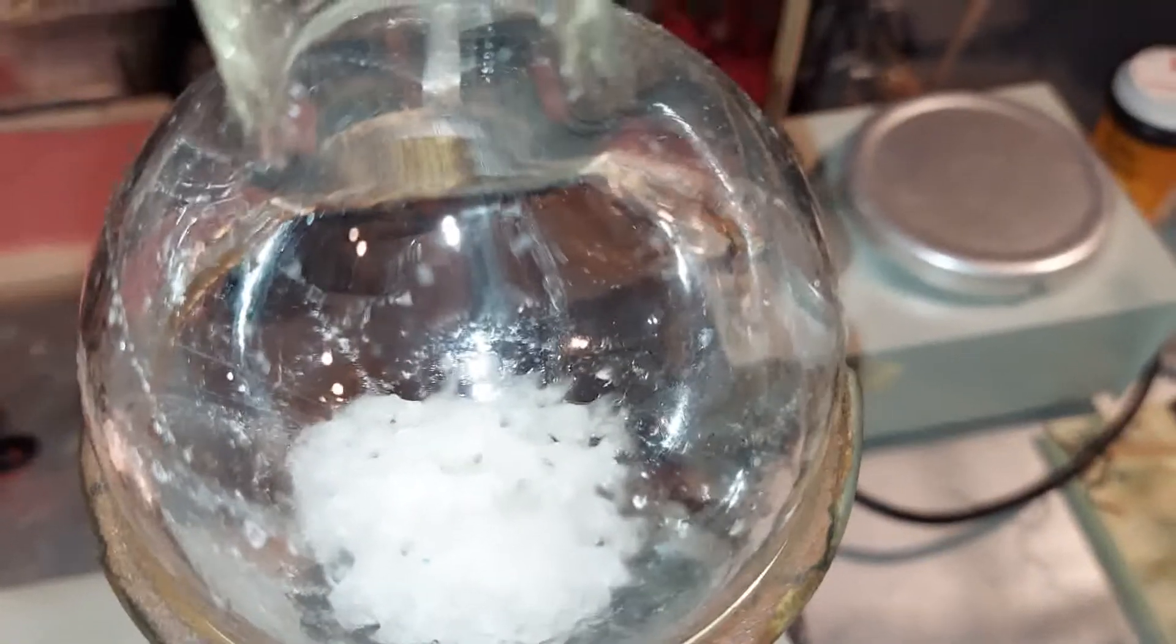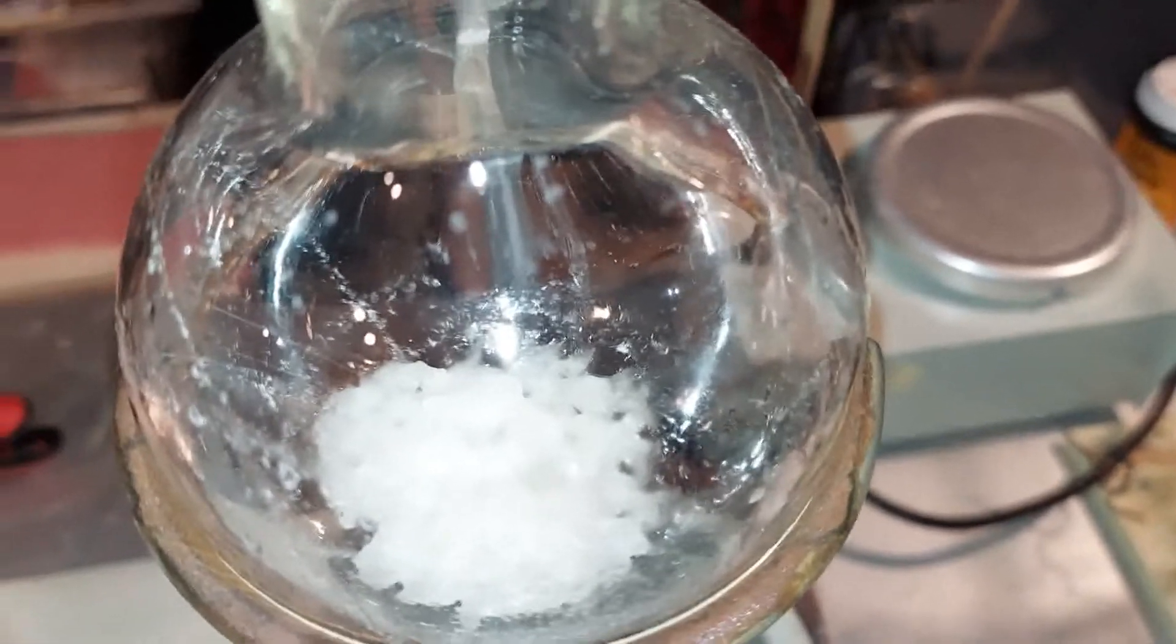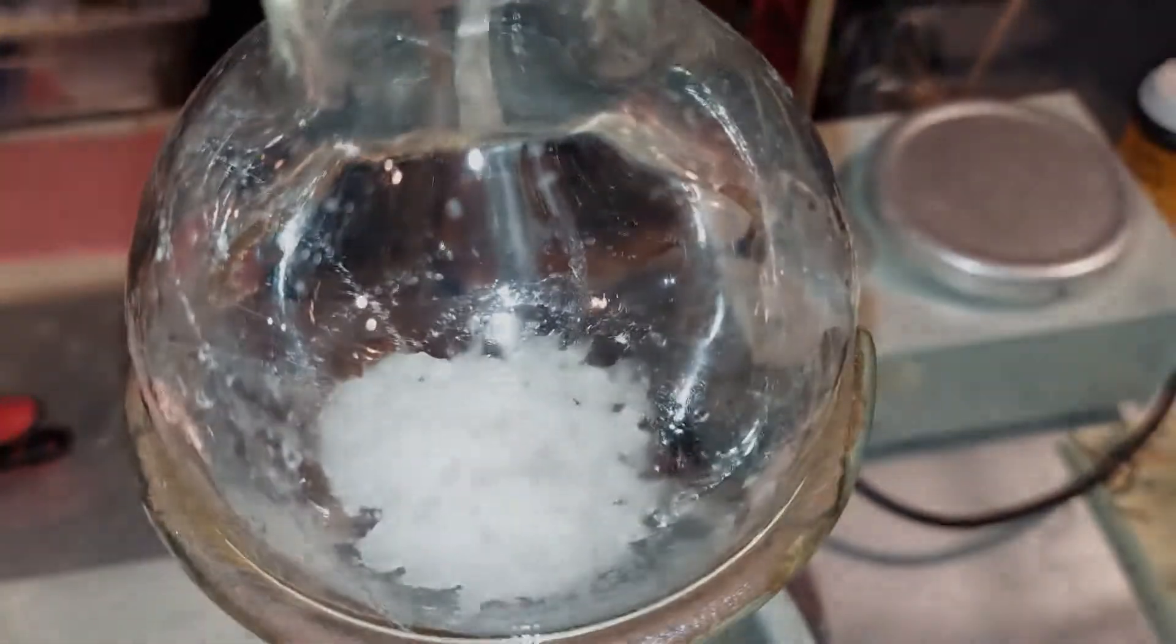I'll be able to wash it out of there, dry it, and it will be good as new.